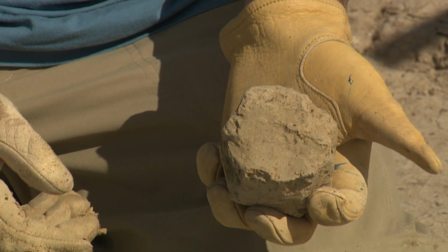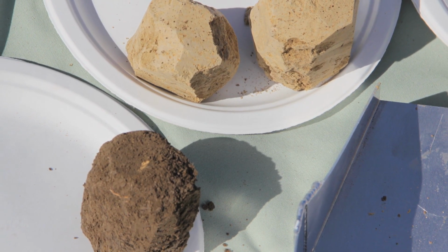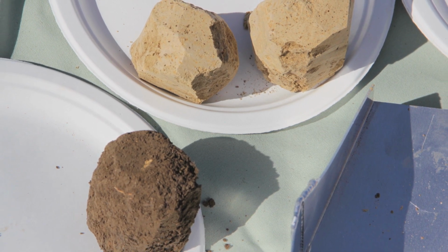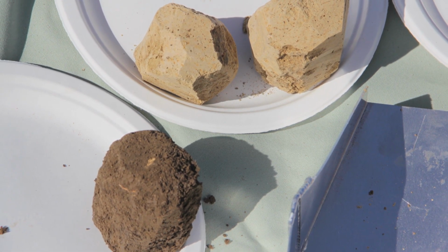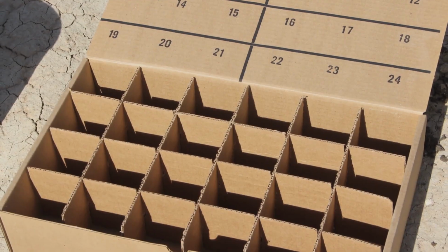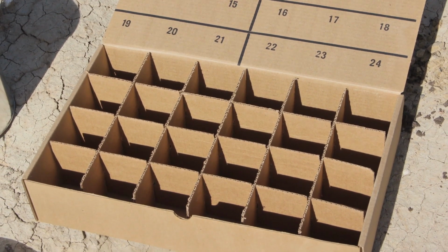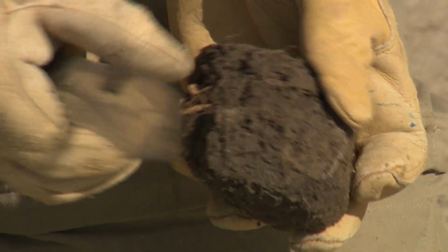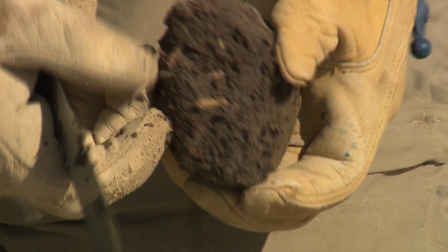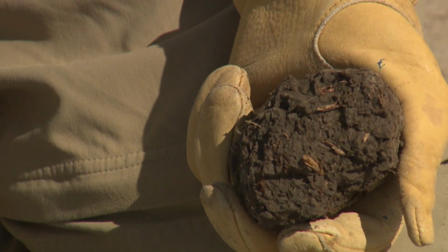Several clods have already been trimmed down to size to remove excess knife marks or any kind of debris that might be adhered to the outside of the clod, so that we have as pristine and intact a primary clod as possible. Additional clods here have not yet been trimmed down to size. These clods have to fit inside the cells in these shipping boxes. So we typically just use a knife to trim it down to an appropriate size, roughly the size of a very large apple or a potato.